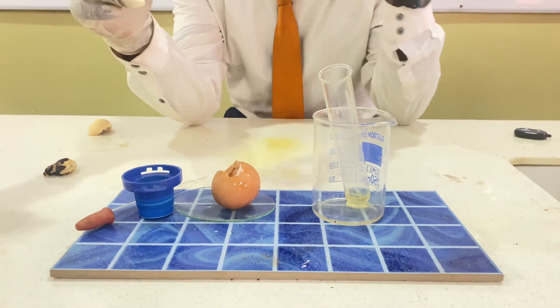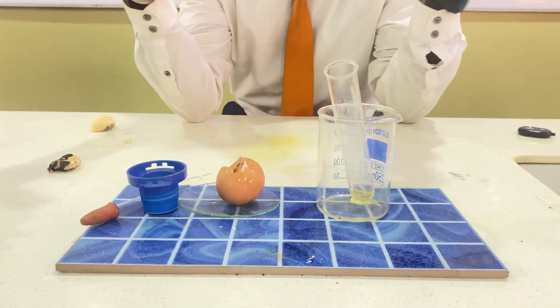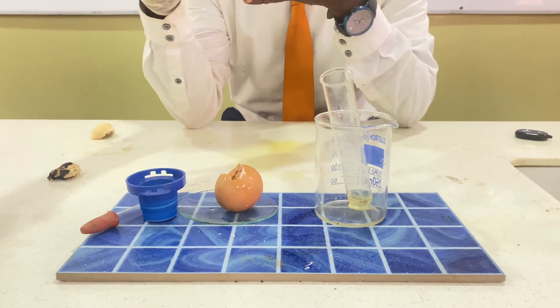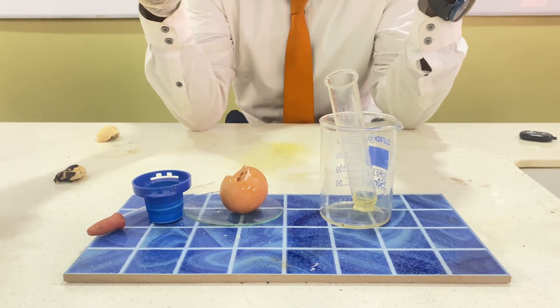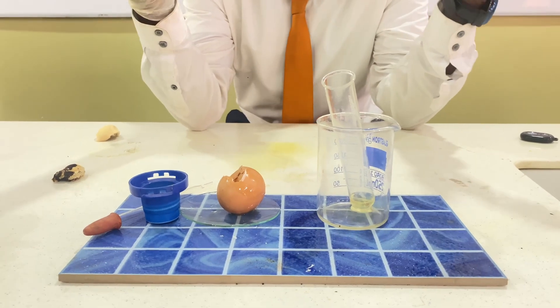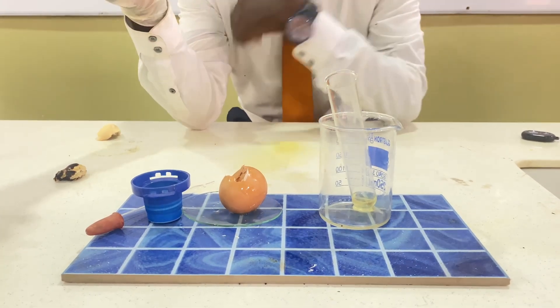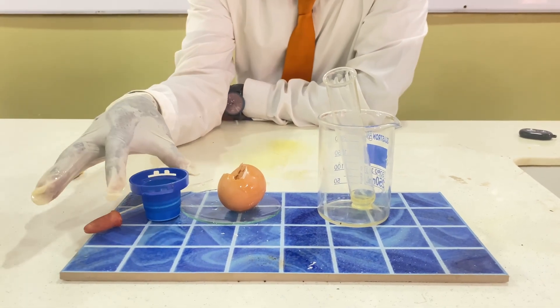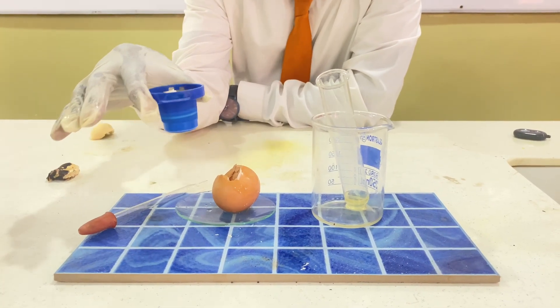Today's test is going to be the protein test. Protein is a food substance that we find in plants and animals. Scientists can use chemicals to test for the presence of this food substance. To test for protein, you need a reagent known as Millon's reagent. There are other reagents, but today we are using Millon's reagent.